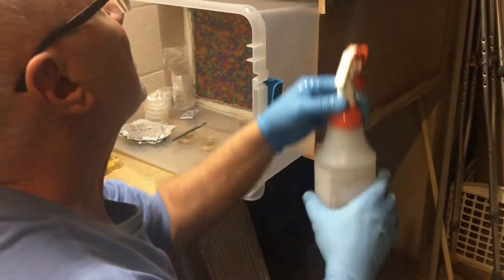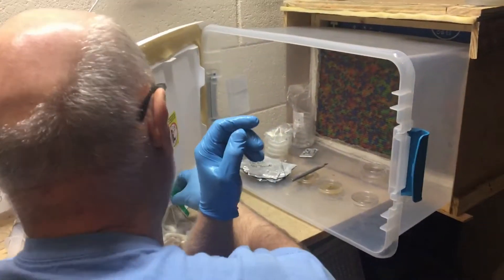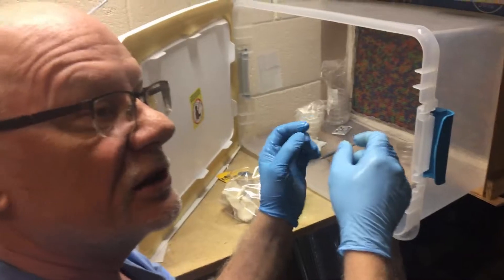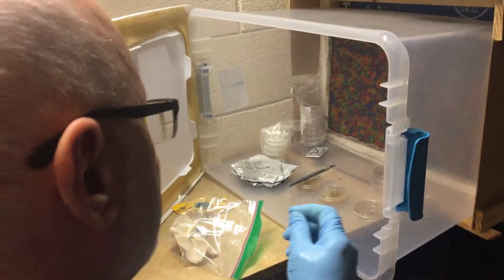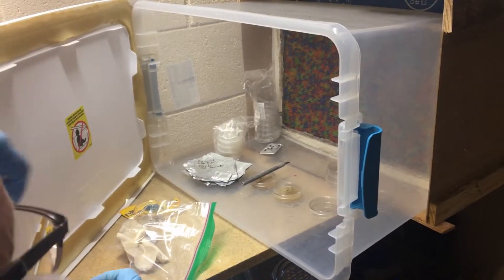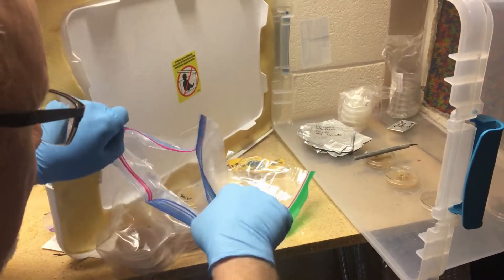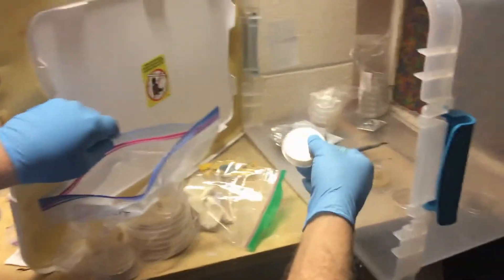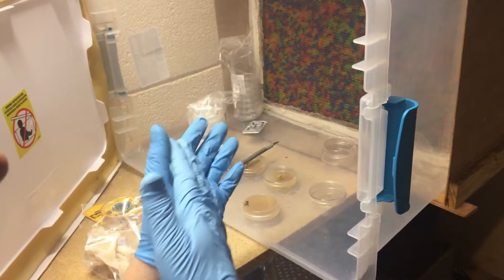There are several different ways you can do spore deposition. In fact, some people simply do cloning — they'll get a piece of tissue from a mushroom and deposit it on the agar. That's fine, but what I am planning on doing today has to do with growing from spores. Growing from spores allows you to get a little more genetic variation than you would get if you just clone it. Cloning gives you only the exact genetic makeup of the parent.